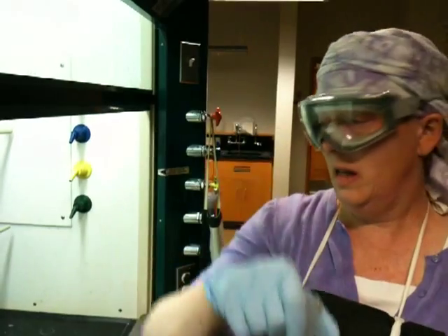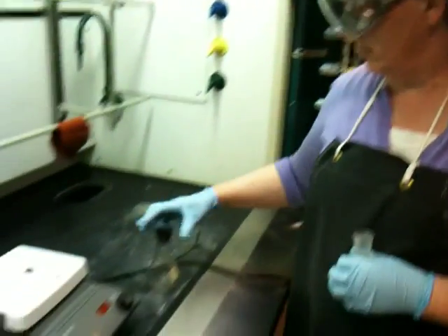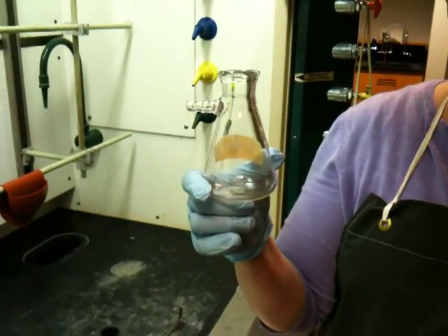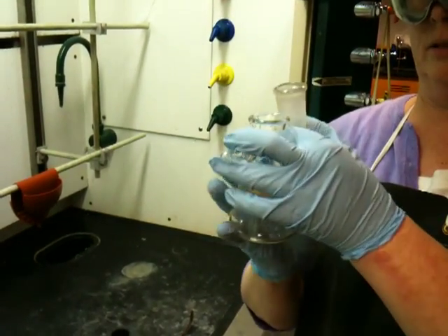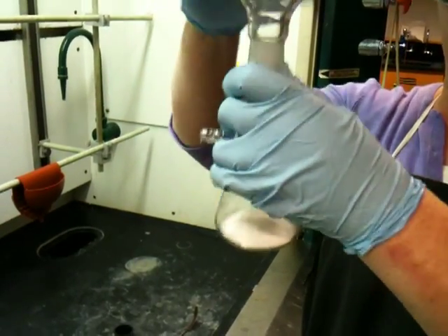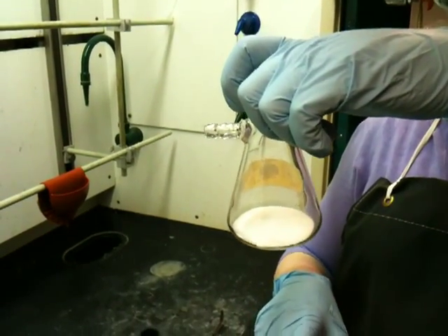The compound then has to be transferred into a suction flask. In your kit, you have a suction flask that looks like this — this is a 125 milliliter suction flask. You will then take the compound, tip it upside down, and just pop it into this flask so that the compound is laying on the bottom.